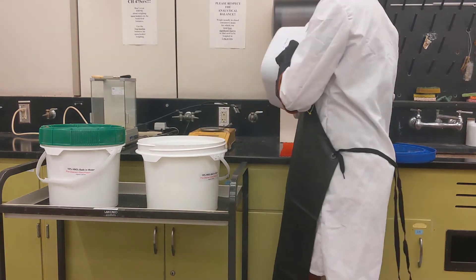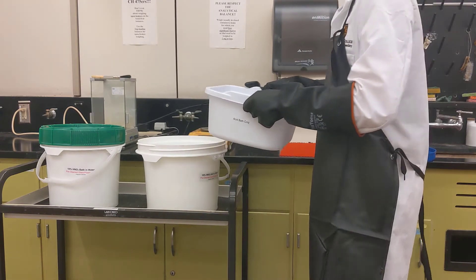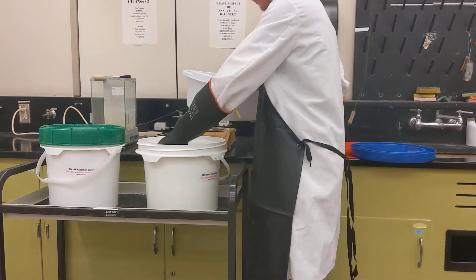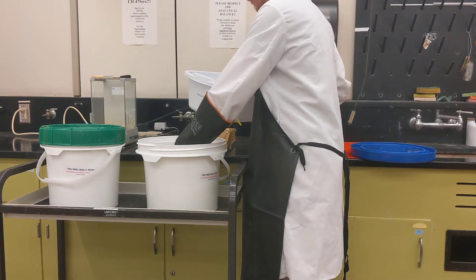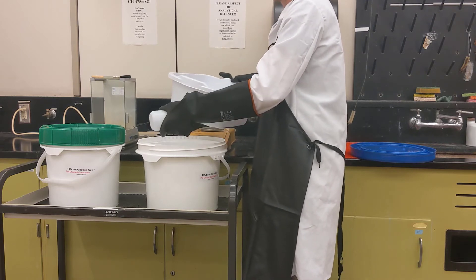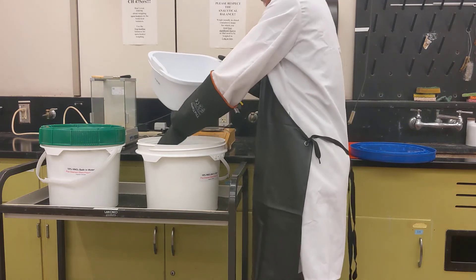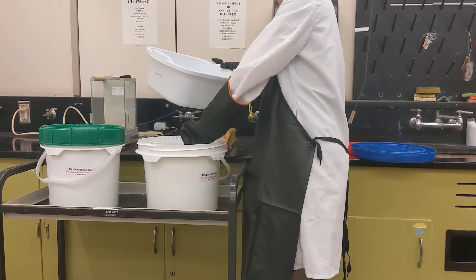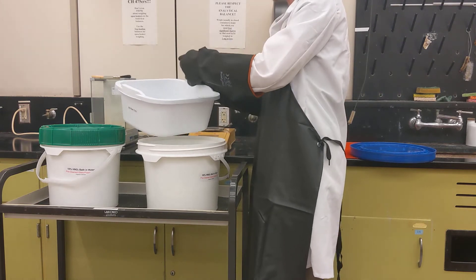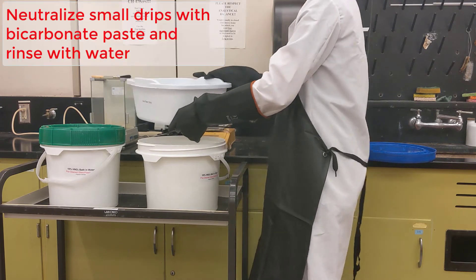You can run it overnight if needed, but preferably not more than one night. We'll pretend here that they've been sitting in there for four hours. To retrieve the items, grab your clean tote and very carefully, without splashing, empty the containers of acid and transfer them directly into the tote — being careful not to splash or spill the acid onto any other work surface. You may have to reach into the bottom to retrieve any smaller items.